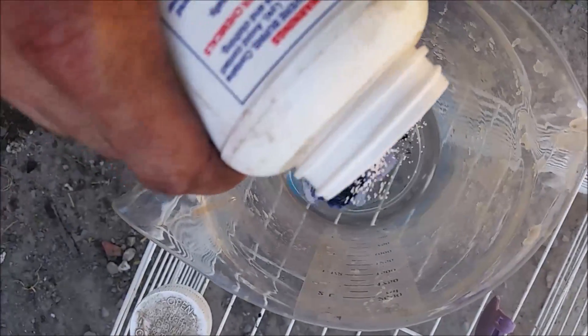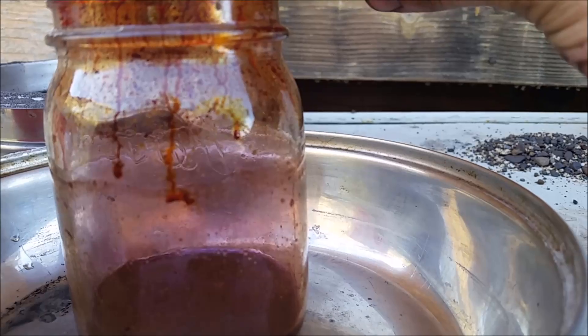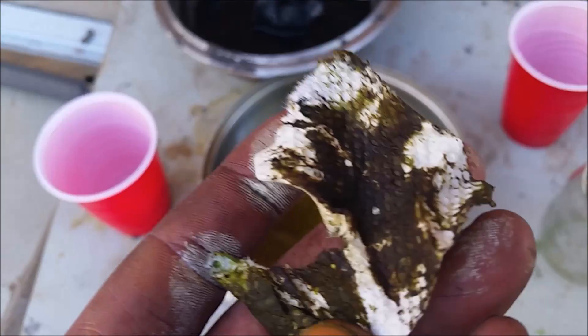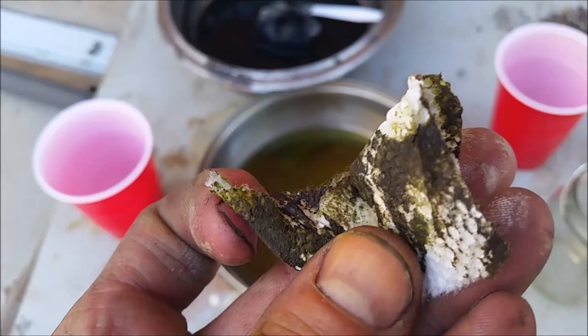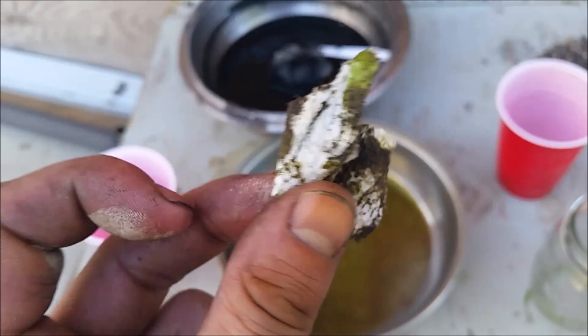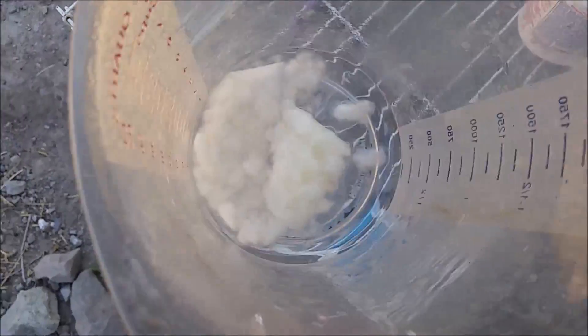Here's the sodium hydroxide — let's see if that'll dissolve it back into solution. It didn't really collect any crystals up there, so let's add the peroxide now and see what happens. It's reacting — well, that might have been a bad idea. I wiped off what was stuck to the pan; it looks like it might have some iodine in there, but could I have made liquid bromine as well? This rag smells like chlorine. I put it inside with the iodine and it went clear, so I guess that means it was in fact iodine or perhaps bromine, and the sodium hydroxide was able to convert it back to a salt.